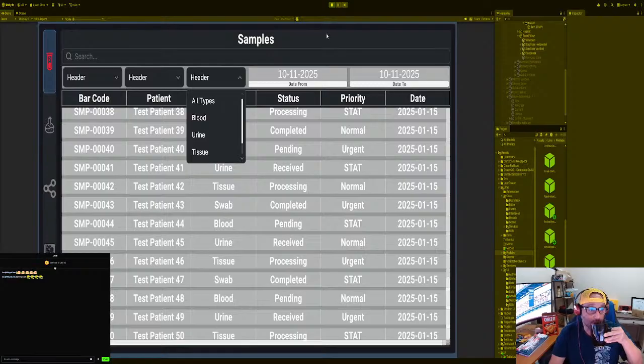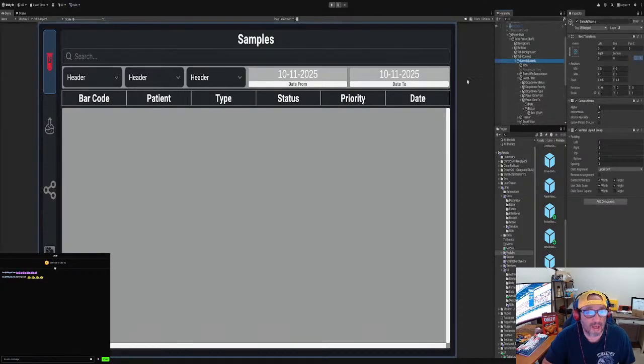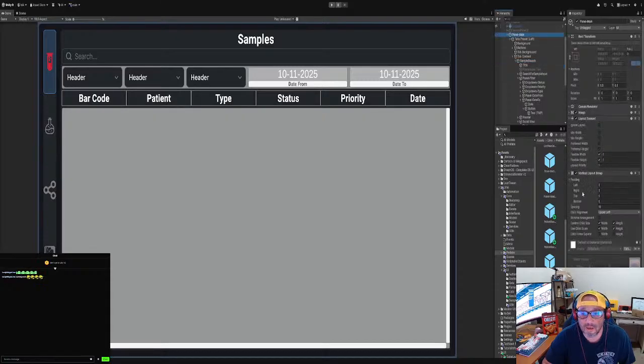All right, so let's go through the script here, and then we could continue on. So we sample search. I put that in the tab. What I did was on here, we kind of need to turn this off because we want to add some windows. We're gonna turn this off for right now. The vertical layout group.